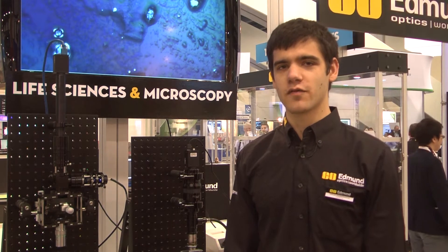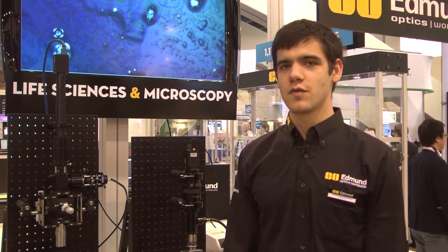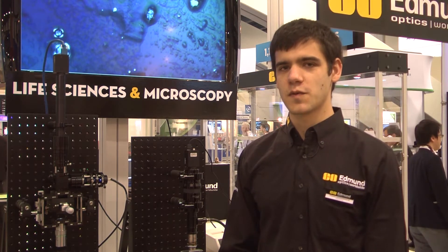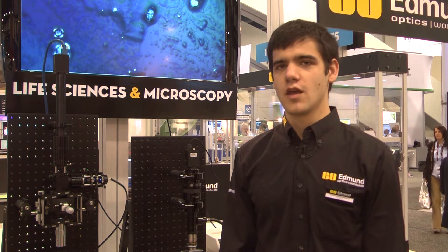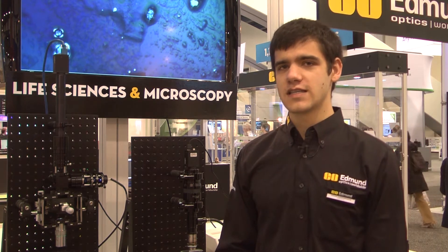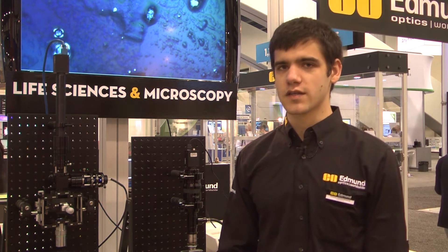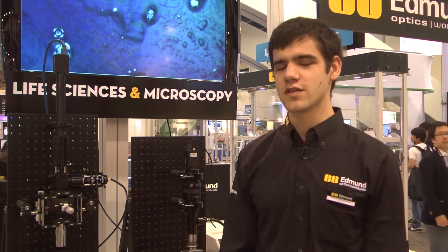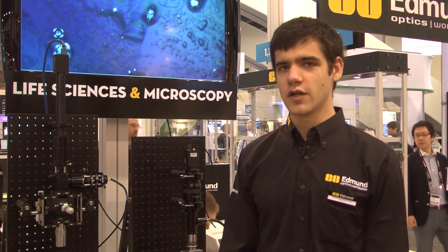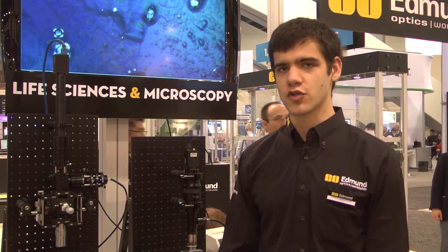This DIC microscope was actually built by one of our product engineers and it was designed in response to one of our needs in our optical lab. We needed a DIC microscope to analyze our optical coatings, and we turned to one of our engineers to build one for us instead of going for a commercial product.